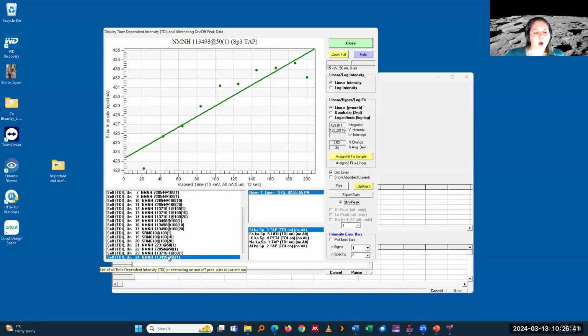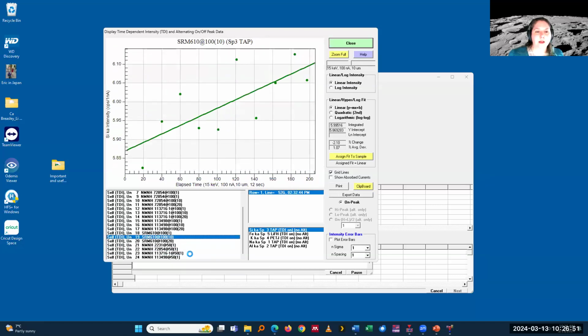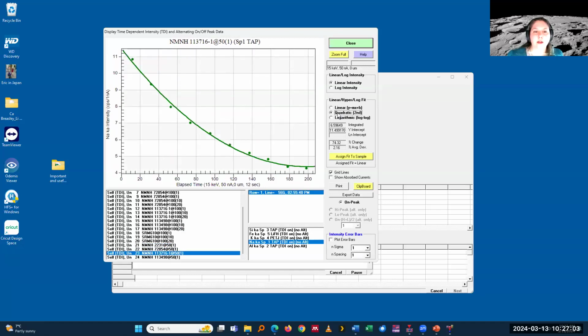And this opens a dialog where all the data is being shown, and I can just go through it again and again for a specific element. I can switch to an element and then go back to the points and go through all of them and see how it does. I can look at and apply how the different fits are. It shows me the goodness of the fit, the calculated intercept, the percent change it does. And in this dialog, I can also assign the fit to the sample.